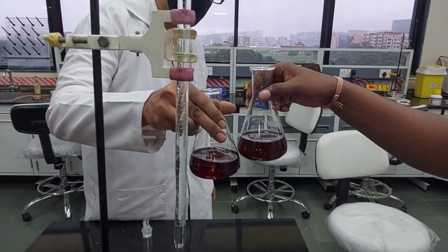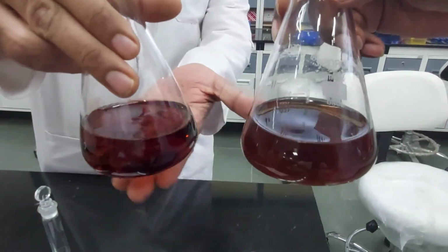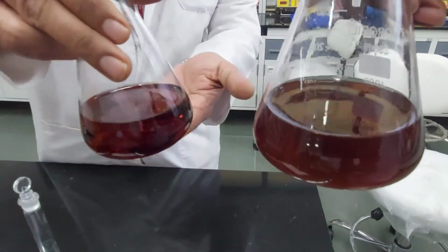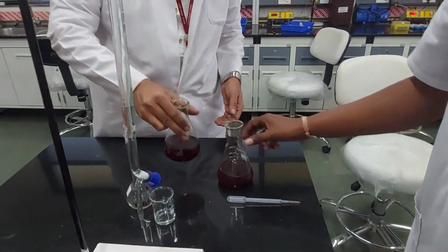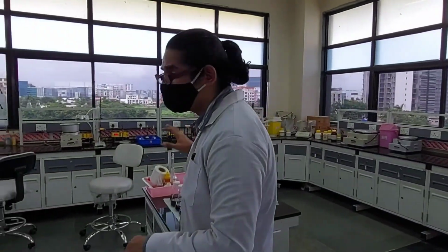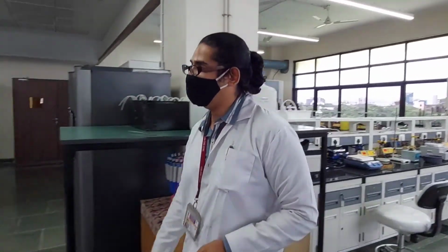Blank versus our sand soil sample. Right. You can already see there is probably some organic component in this sand soil sample, but we shall see after doing all the calculations. But this is our blank and that's our soil sample. Likewise, all the soil samples will be processed, titrated, and the readings will be noted. For all the titrations we already had done it. So this was the demonstration of what kind of color change we are going to see. But for all the samples we had done together, we already have some of those values written over here.